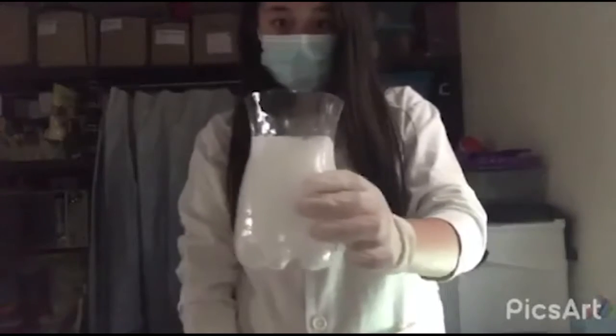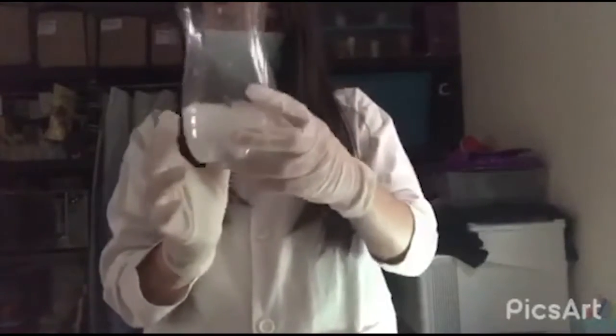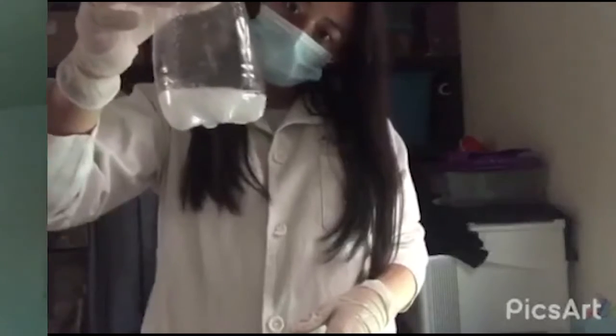We can observe how it also effervesces. This is an example of a chemical reaction due to the interaction of the molecules to make the foam produced by the vinegar and baking soda.